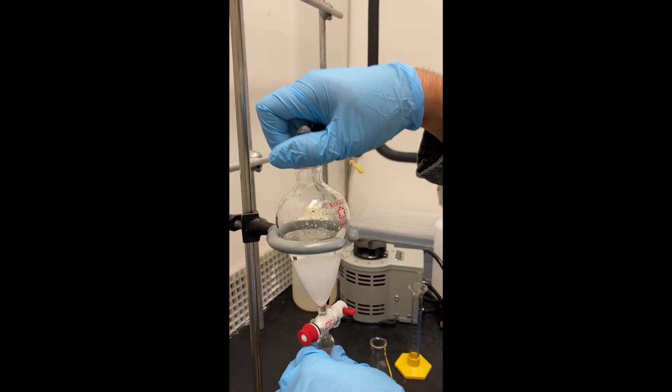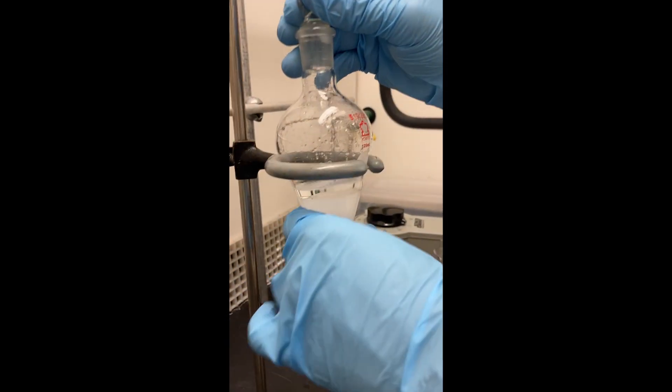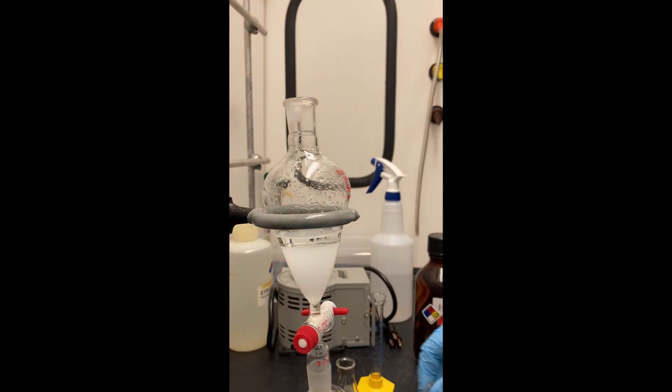Next we'll want to separate our liquids. Since we know the density of water is higher than the density of hexanes, our aqueous layer will be on the bottom.